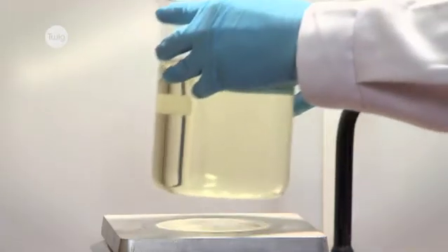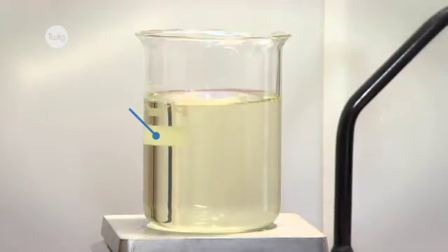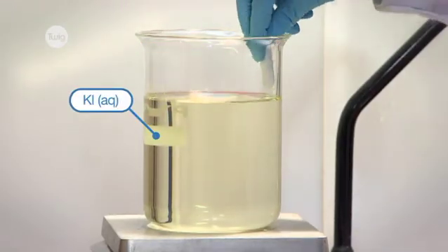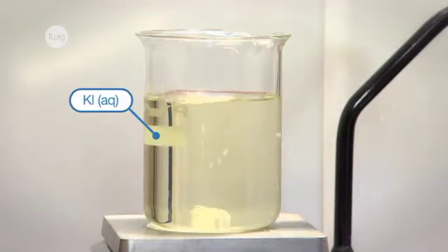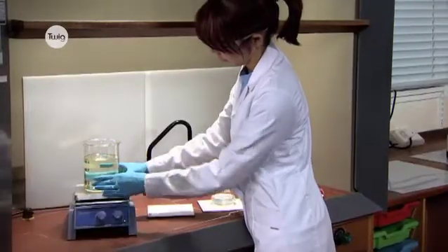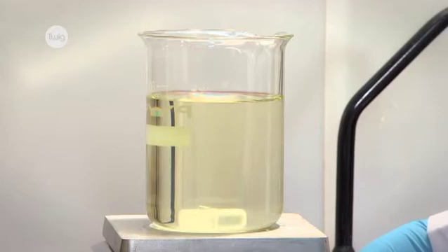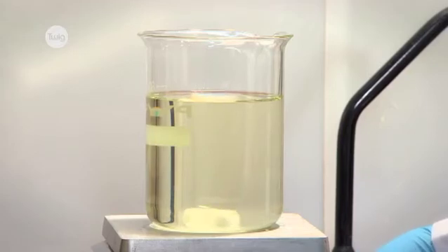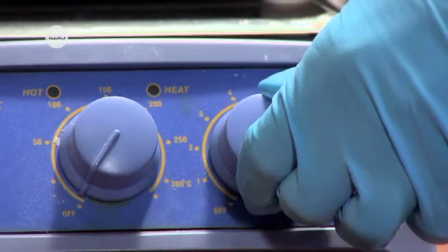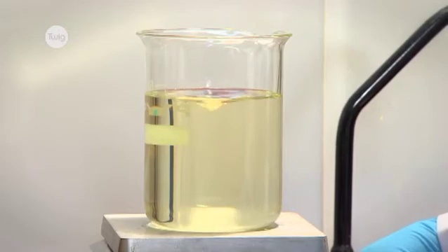In a fume cupboard we place saturated potassium iodide solution on the magnetic stirrer and drop the magnetic bar into the beaker, then centre it. We turn on the stirrer and adjust the speed so that a vortex forms in the centre of the beaker.